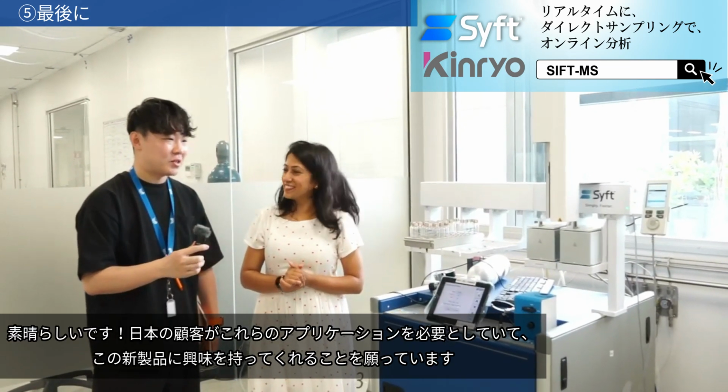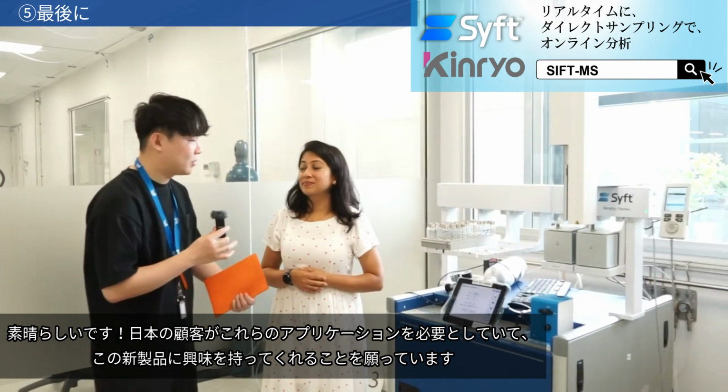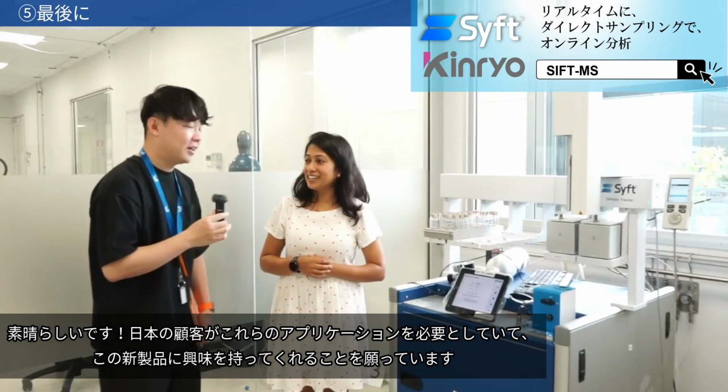Very nice. So yeah, I hope the Japanese customers who have those applications will be interested in our new products.